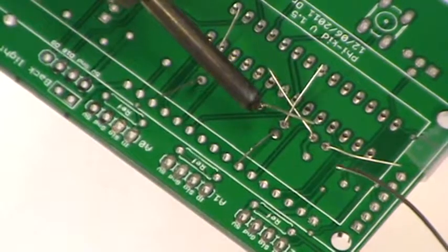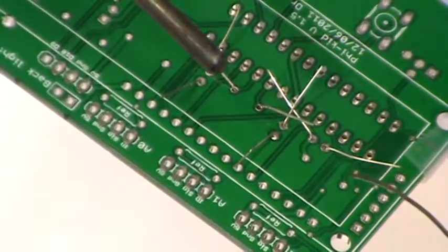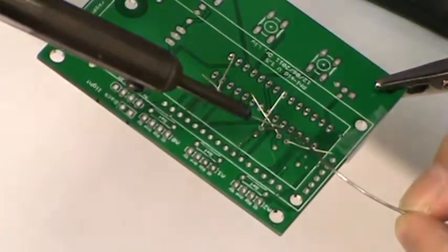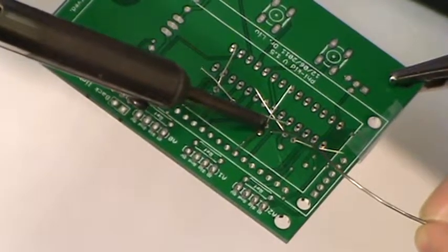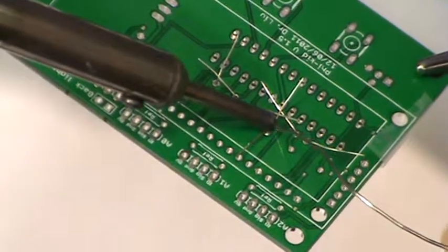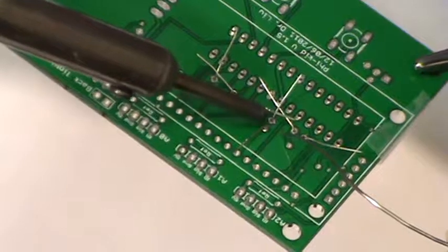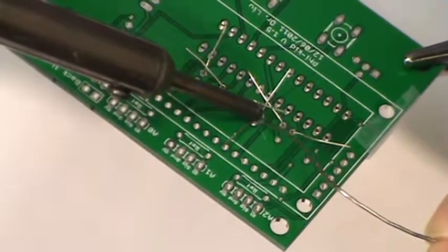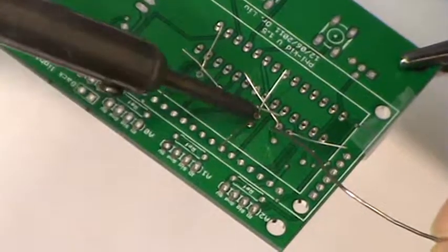So if you make a good soldering joint, it will actually look pretty good on the close-up. Although we're not really doing close-up yet, but if you actually didn't do a good enough job, it looks like a Kisses chocolate. So the bottom will actually kind of taper, instead of wetting the entire board.